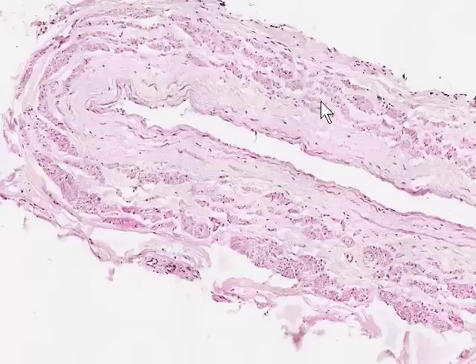And this is a significant difference between the organization of smooth muscle in large veins versus that in large arteries. The muscle doesn't form a continuous longitudinal layer or indeed a continuous longitudinal bundle, but as we can see, it's scattered islands of smooth muscle oriented longitudinally, in between which are very large amounts of connective tissue.